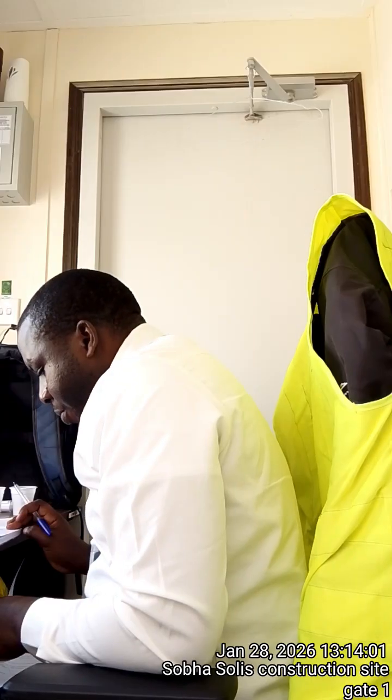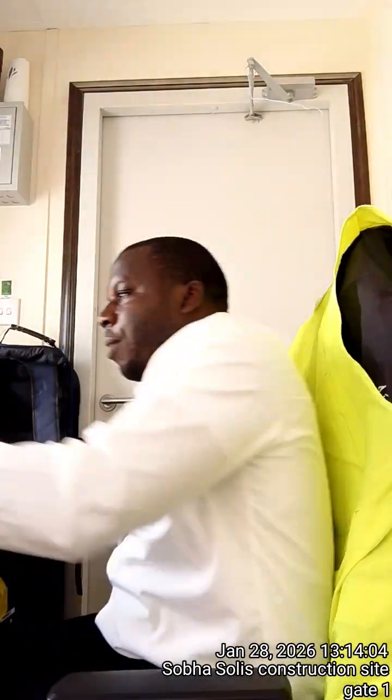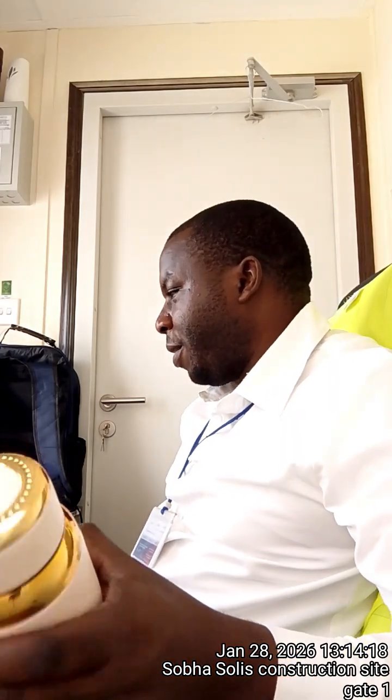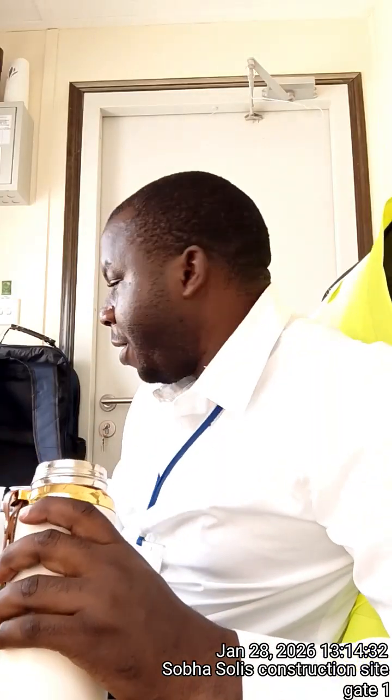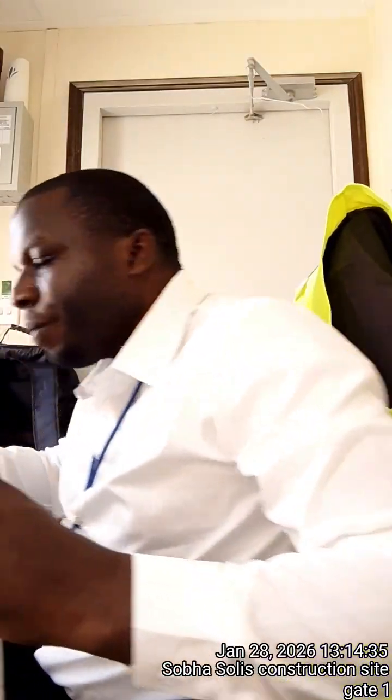But still, we can use our sample. Remember this sample here? This is what we call the pH indicator. So now that I don't have the litmus paper to dip into the water, I'm going to use our tap water and the drinking water to run the remaining experiments. So let's see what I have here. Let me add something here and see.